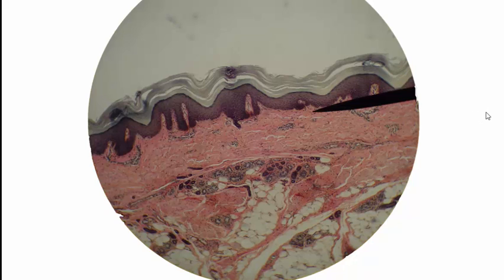For this image, that's probably all we can see here. Let's do a couple of quick review questions. What is this major layer up here? That is the epidermis. What is this major layer way down here? That's the hypodermis, or subcutaneous layer. And what major layer is here? That's the dermis. I'll do more questions at the end of the video. I'll have a whole sequence of questions to help you review.